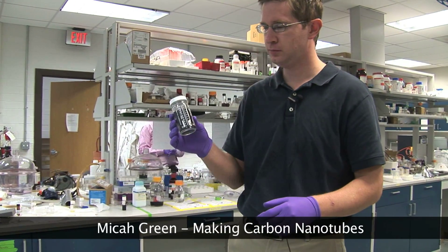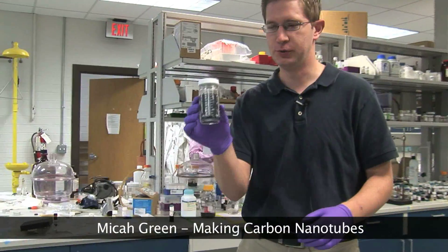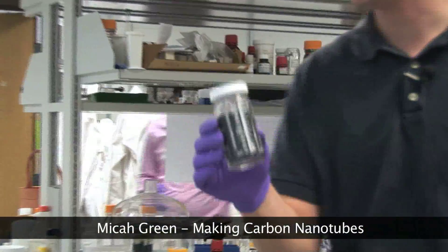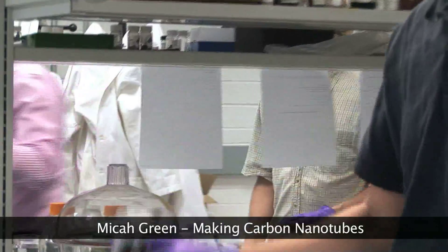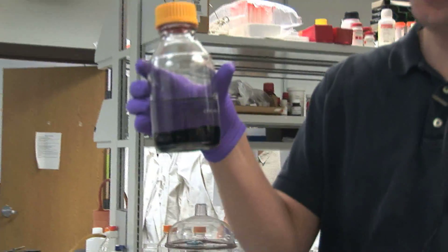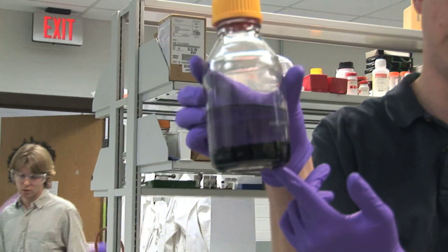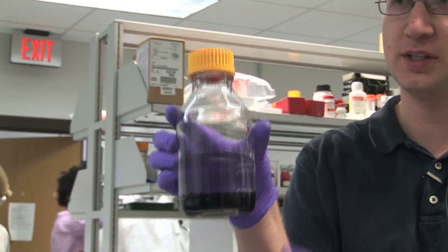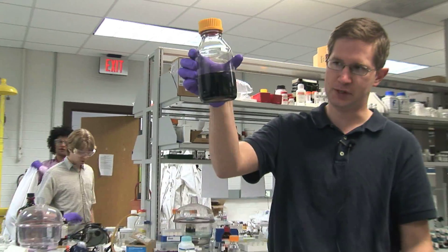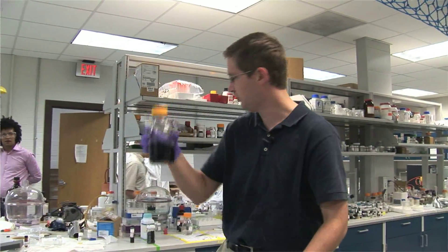Nanotubes in their solid form look like this, and the idea would be to disperse these in a liquid so that we can process them. However, for most solvents — like water — if you put nanotubes in the solvent they don't disperse; they just all settle out at the bottom like that. You can't use something like that. If you shake it, they kind of come up, but they'll just settle right back out.